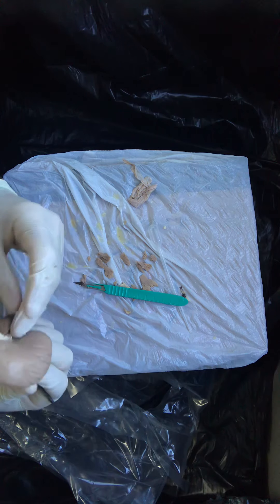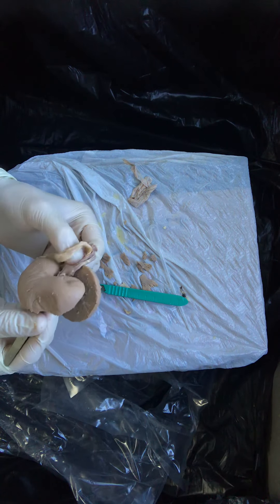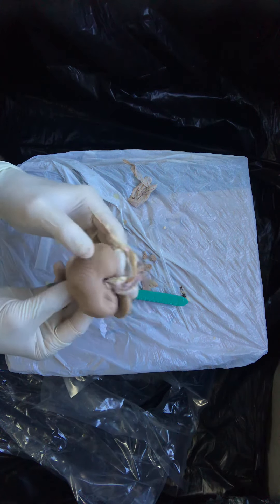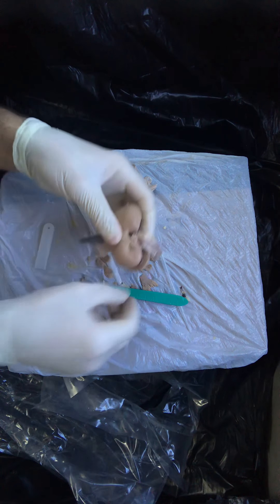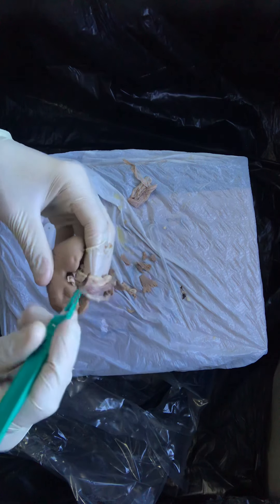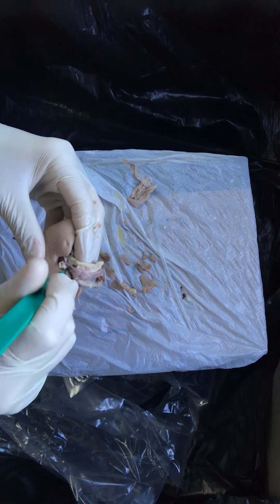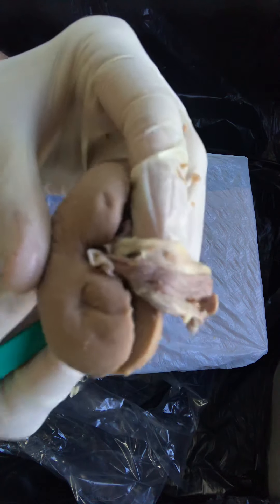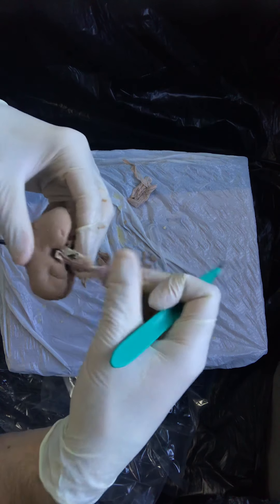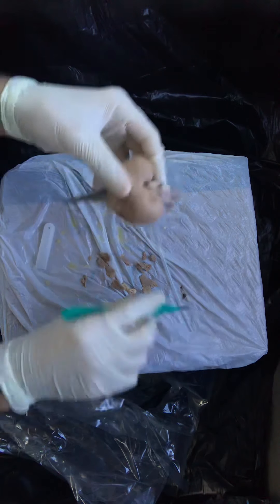Actually, look at this — just by pure luck, honestly, I was able to weasel my pickups down and into the ureter. So I'm going to incise the ureter from the inside out. You can almost see the tip of my instrument through the tissue. I made a little nick with my scalpel over it, and you can see the tips of my pickups coming out through the lumen of the ureter, which is larger close to the kidney and narrows as you go farther away.